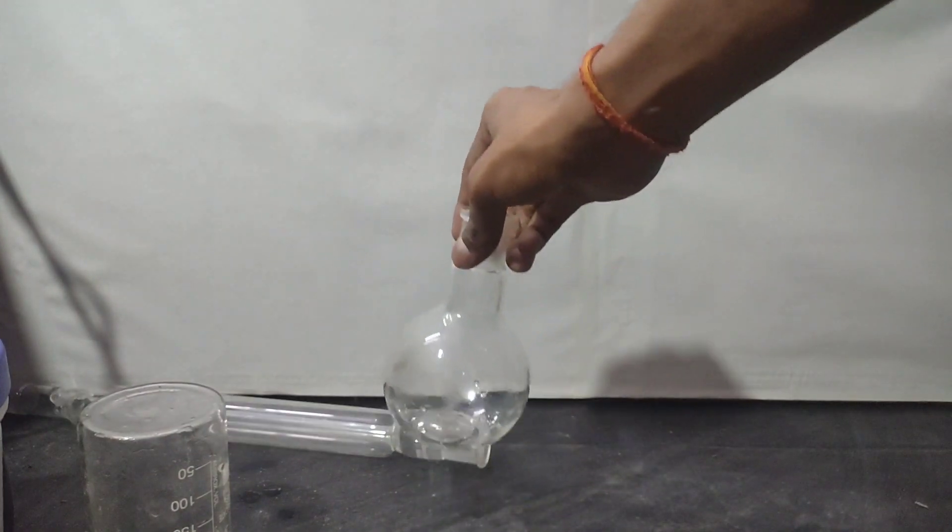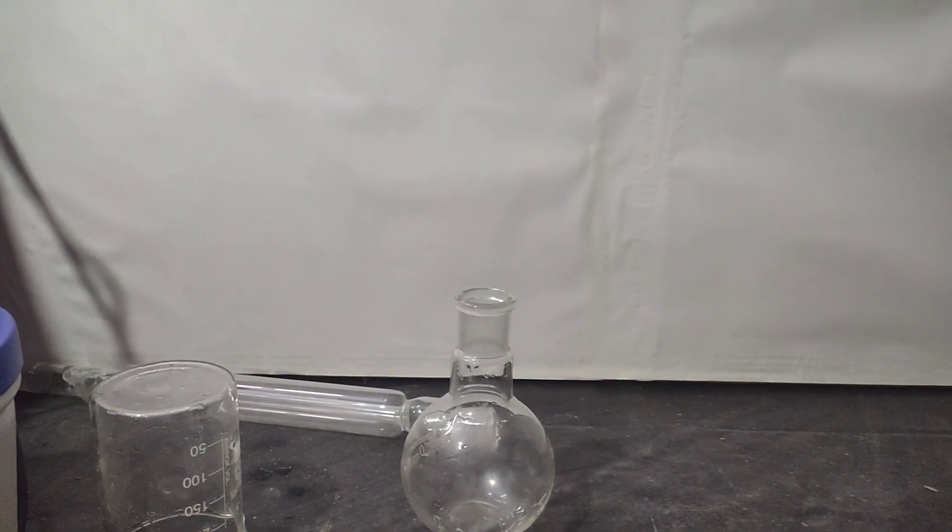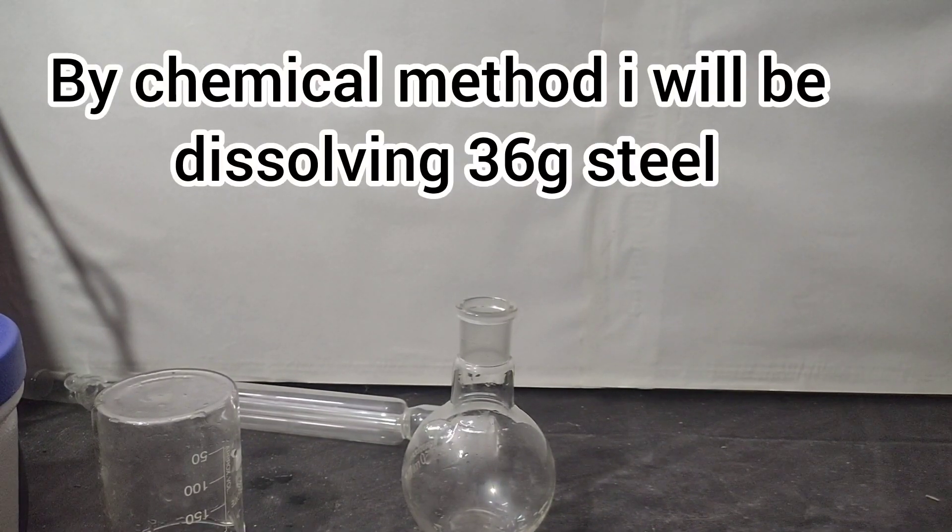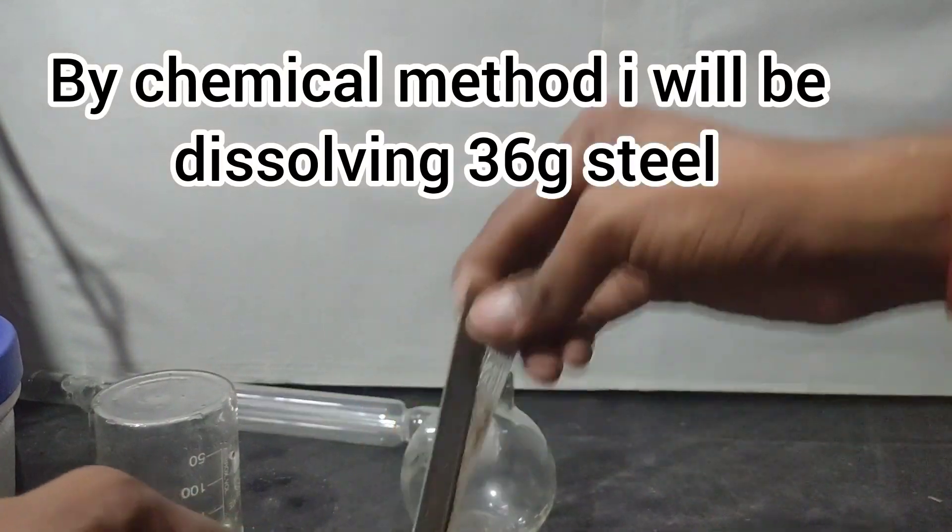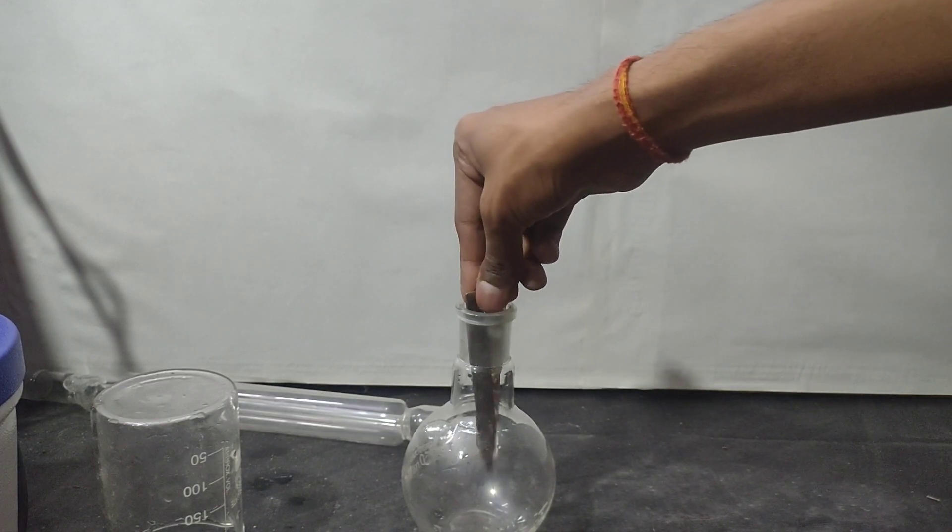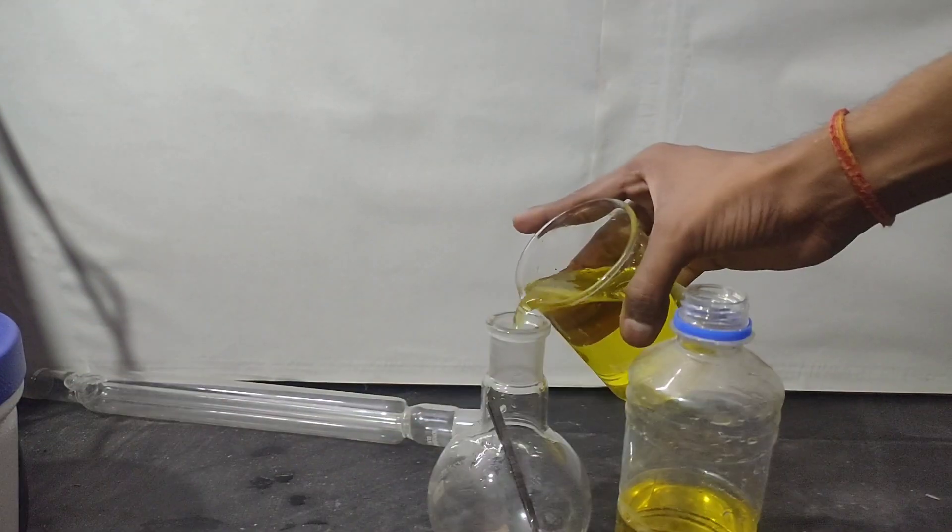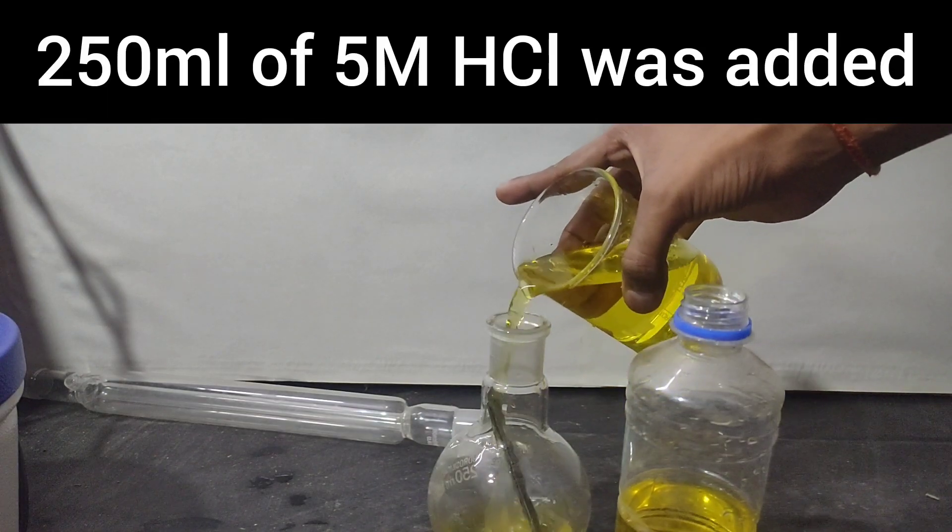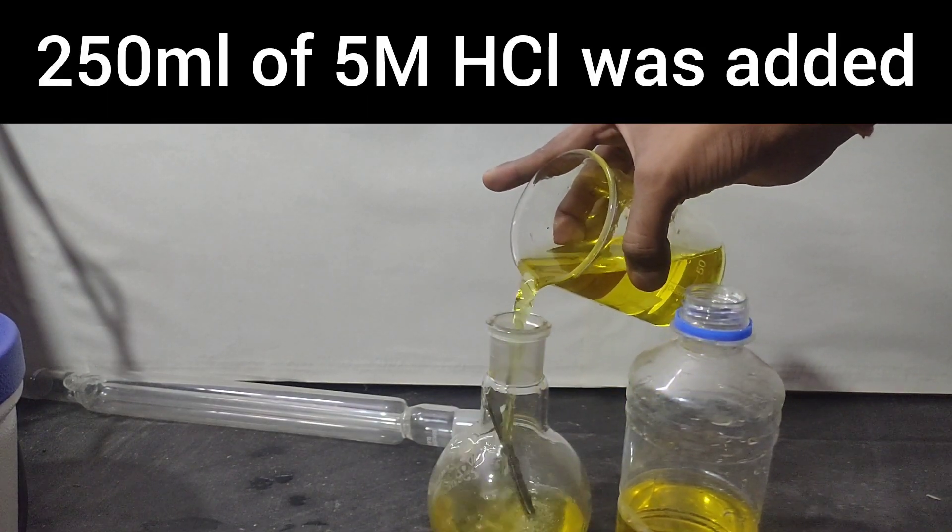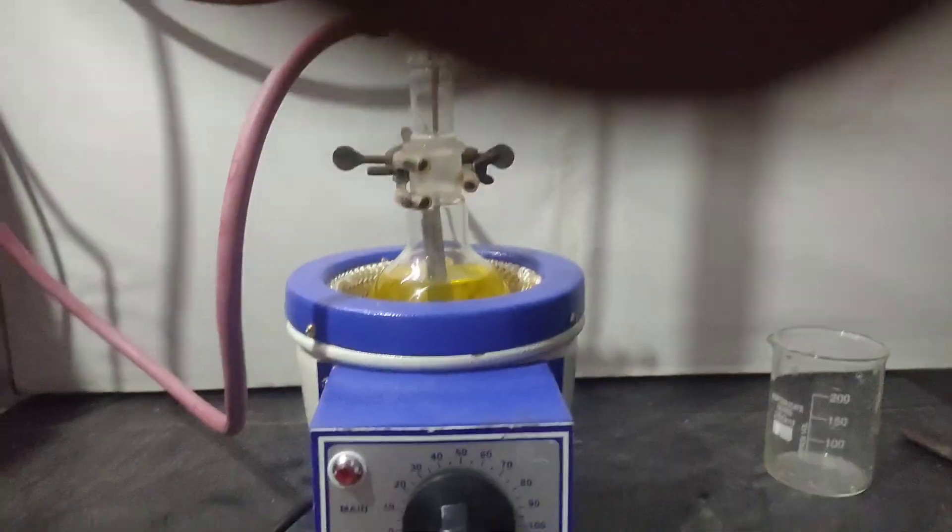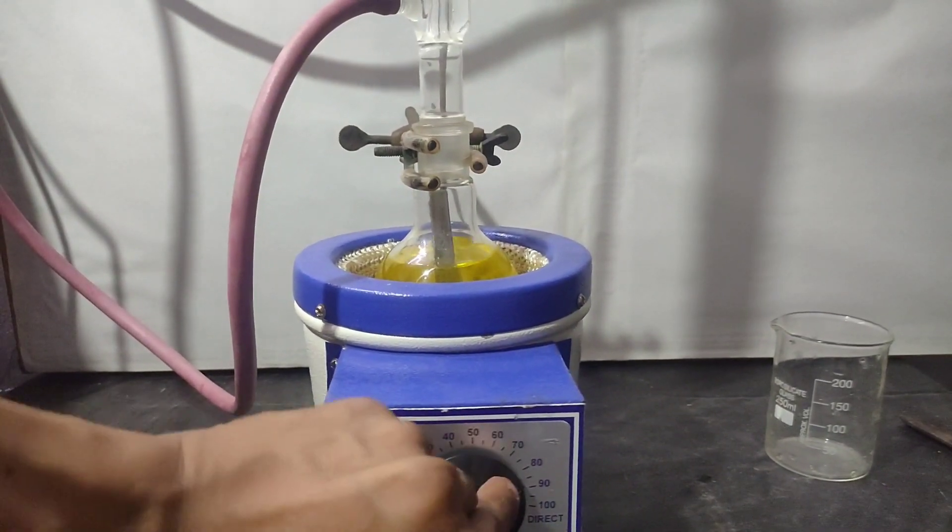Now I show you the chemical method. I am adding 36 gram stainless steel, which includes cutlery left from electrolysis process, into this 250 ml flat bottom flask. To this I added 250 ml of 5 molar HCl and set the apparatus on reflux.